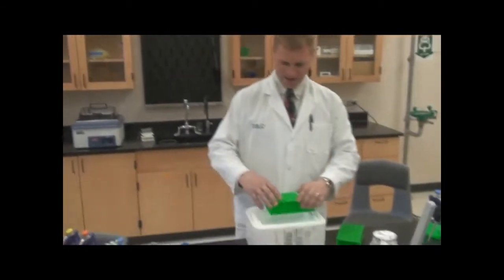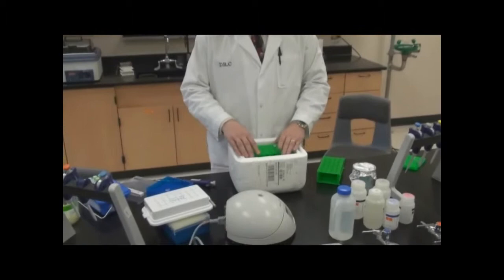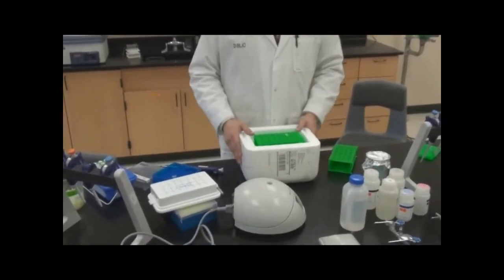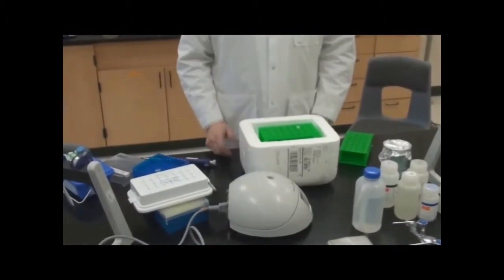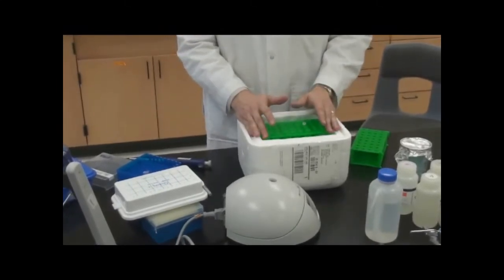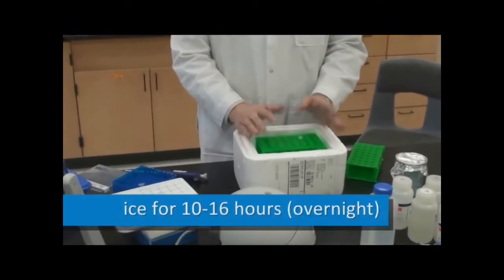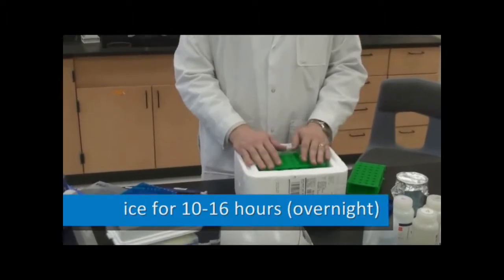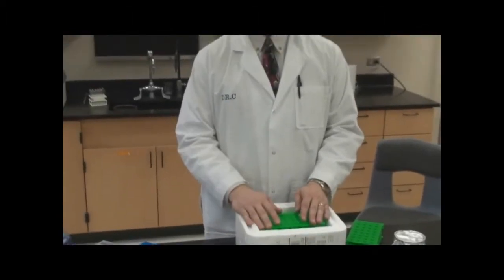So now we've got our ice bucket, we've got our ligation reaction. I'm just going to set it right on there and snuggle it down in the ice a little bit, and we're done. And I'll let this now sit for anywhere from about ten to sixteen hours. That's usually about overnight, so if I set this up about five o'clock, I'll come pick it up about eight o'clock in the morning.